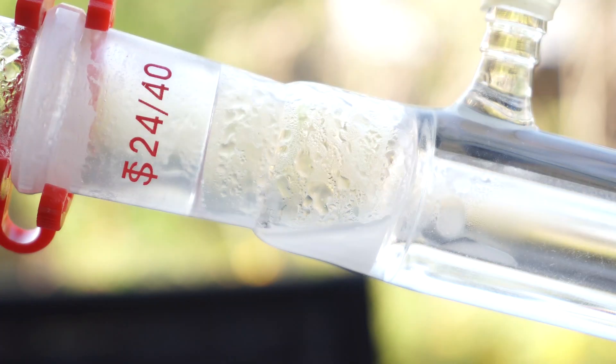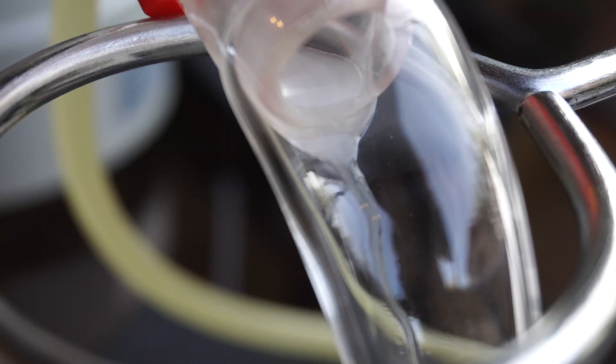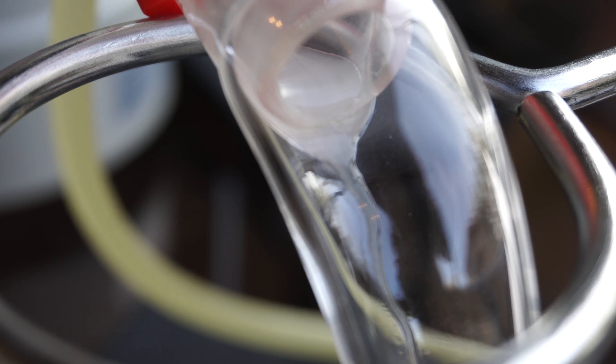As the distillation starts, we see a cloudy liquid start to come over. This distillate only looks cloudy because of the cinnamaldehyde and oil that it contains. The oil is held in the suspension, making the water opaque.